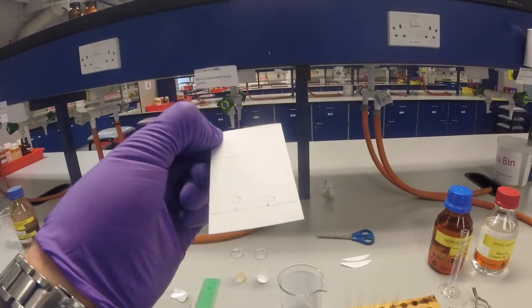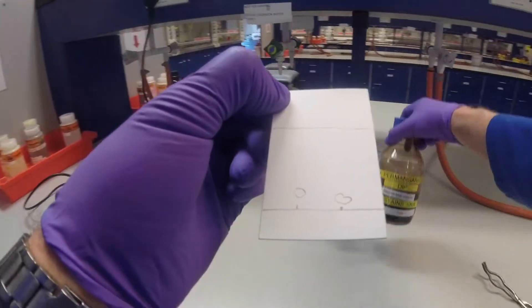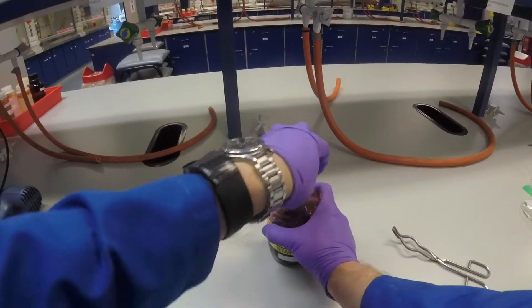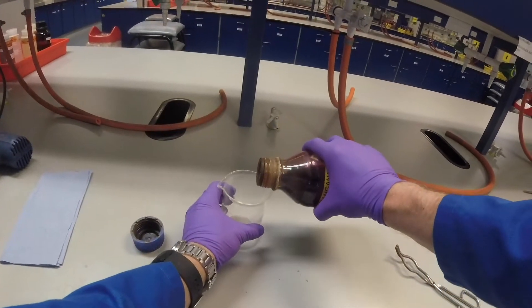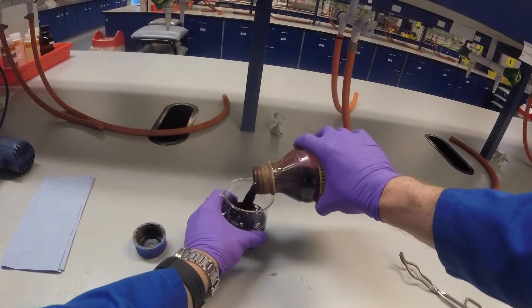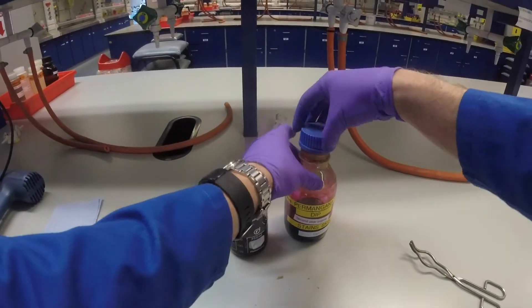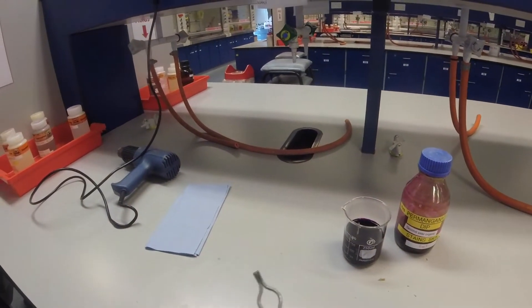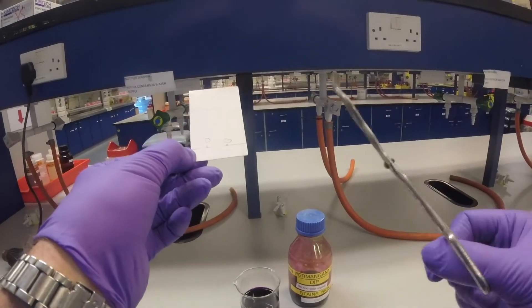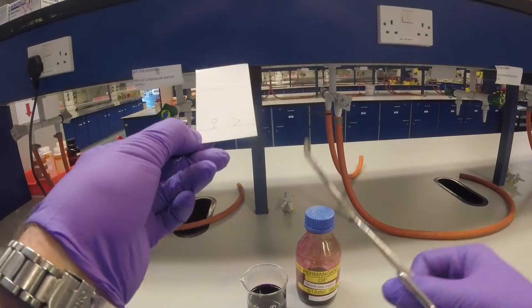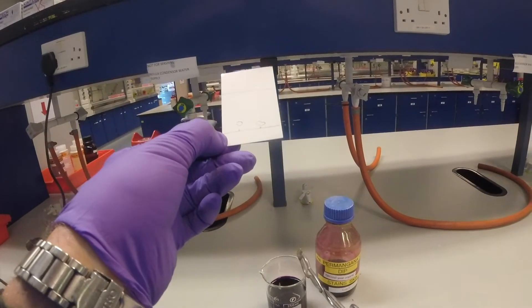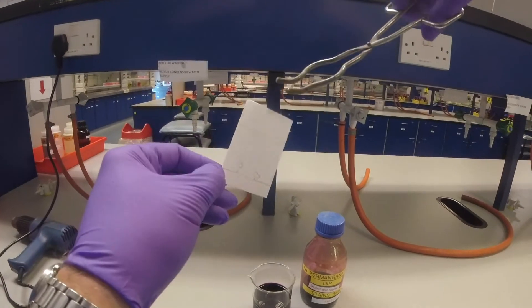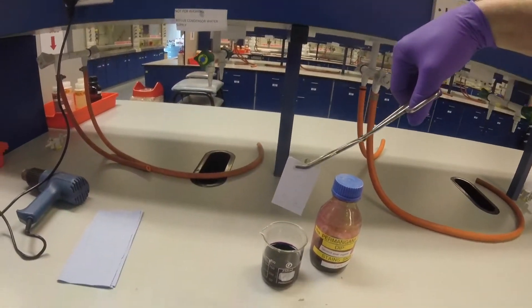We can use a chemical stain instead. One of the simplest to use is potassium permanganate, a nice purple compound. When it reacts with things that can be oxidized, it itself gets reduced, and the form of reduced manganate is yellow. We need to put it into a beaker. We need to make sure all the solvent has evaporated from the surface of our plate. This is permanganate, an aqueous dip, and if there's any organic solvent left on the plate, the dip won't get fully soaked into the silica and it won't properly develop.